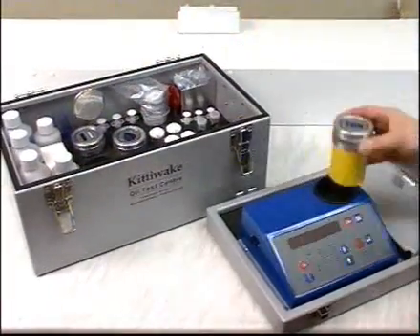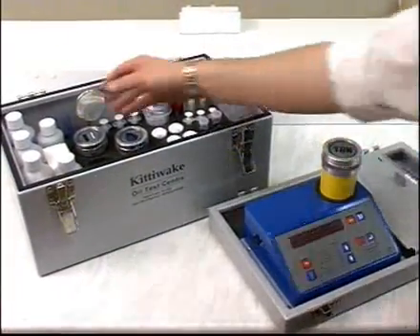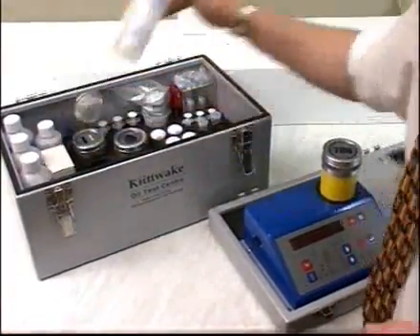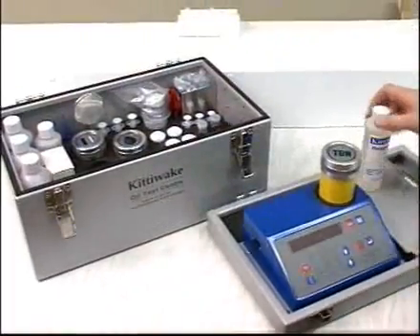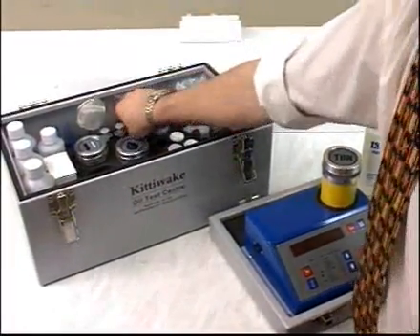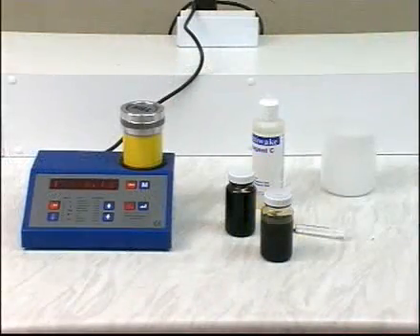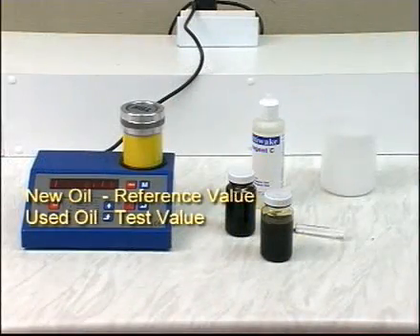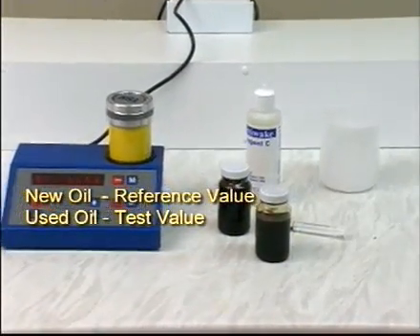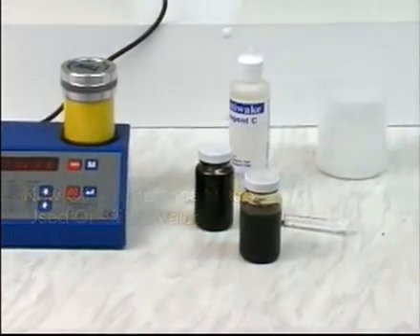This section shows you how to determine the total base number value of the used oil. You will need two values: the reference value from new oil in the storage tank, tested once when loaded, and the test value from used oil in the engine.